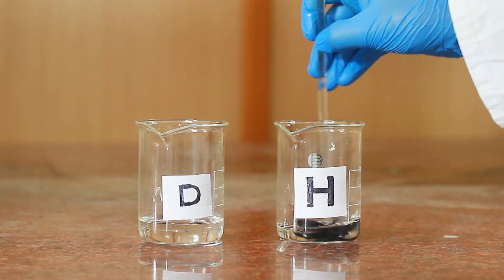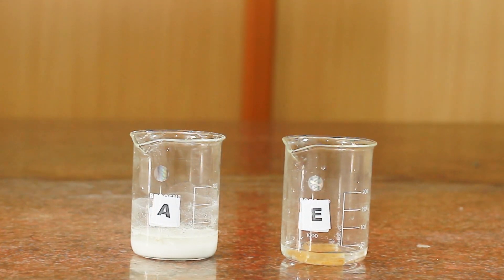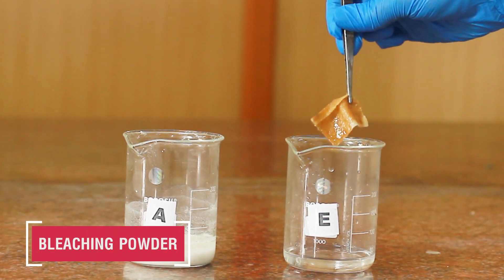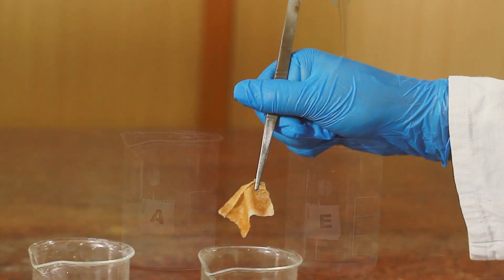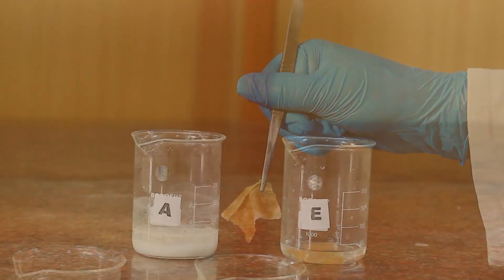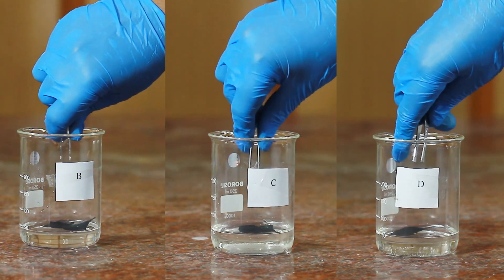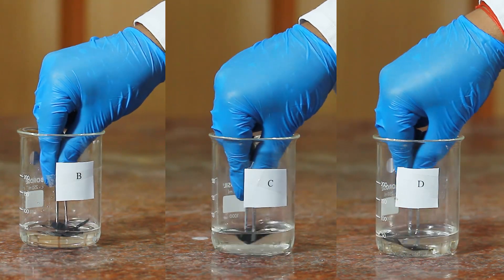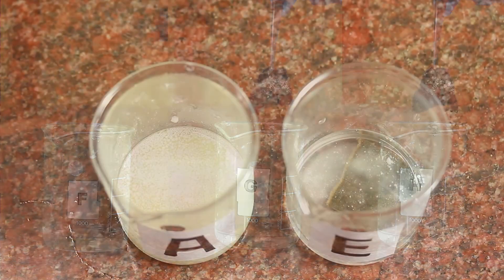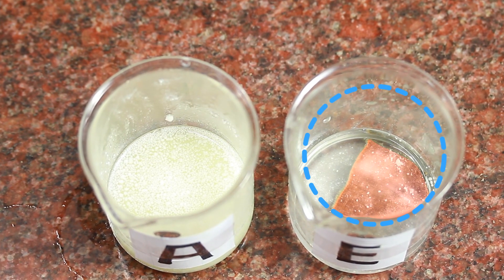Observation: The cloth which was dipped in beaker A gets discolored — that is, the black color of the cloth gets faded. Thus, compound A is the bleaching powder. The cloth dipped in beakers B, C, and D show no change in color. The black color of the cloth dipped in solution A gets completely bleached out.